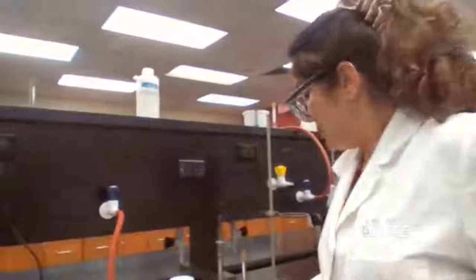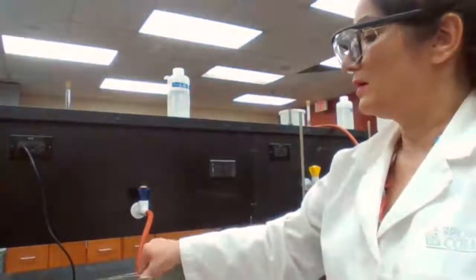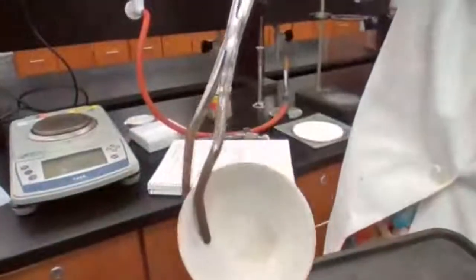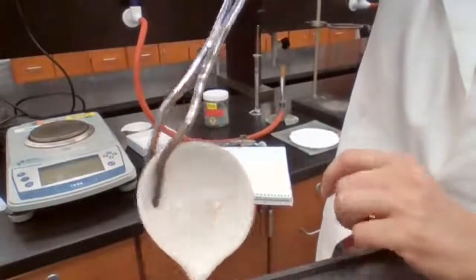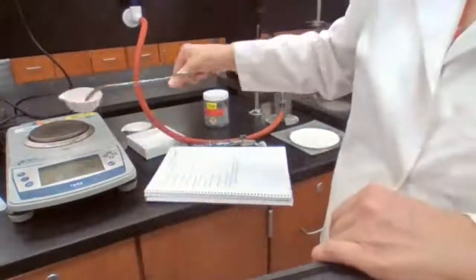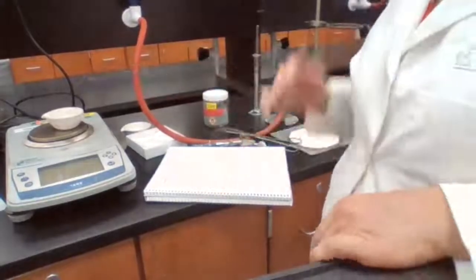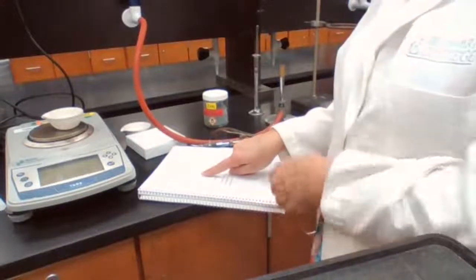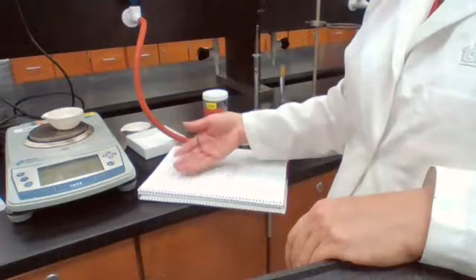That's for part B. Part C is asking for the color of the zinc iodide powder, which is a white powder, white solid. And that should go to part C of the data sheet. Everything else, like the mass of the zinc iodide, you need to do the calculation based on the information that you have.